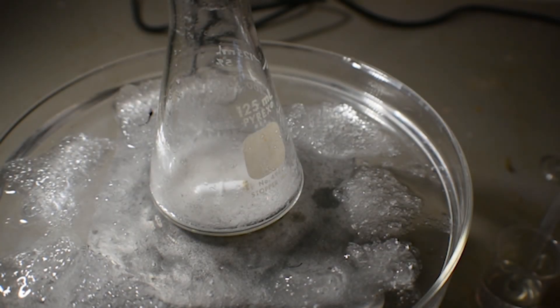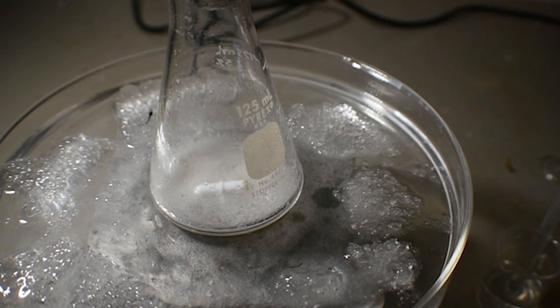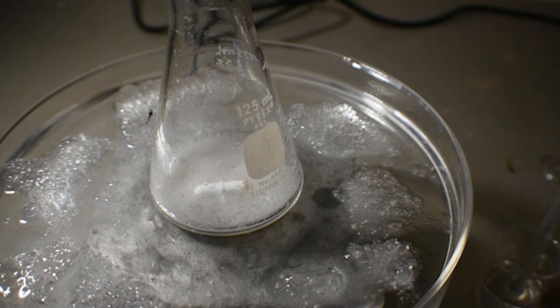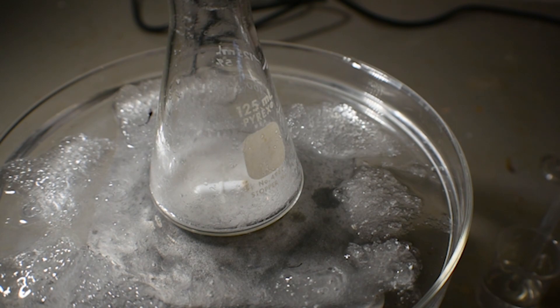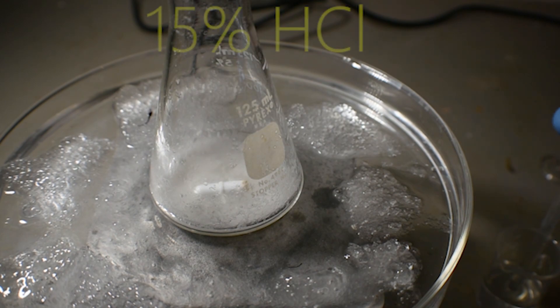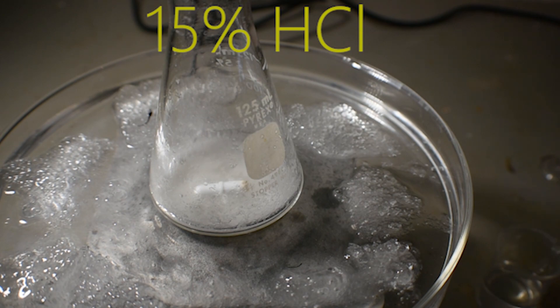Now that the mixture has had about 15 minutes to set, I can begin acidifying the mixture with 15% hydrochloric acid. You only want to go until it's just acidic. This will evolve hydrogen, so do keep that in mind.